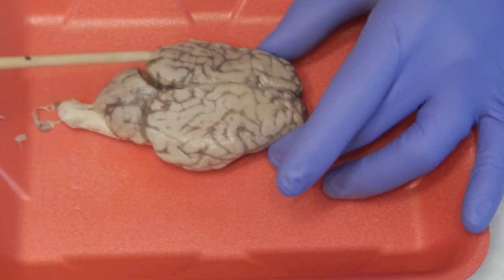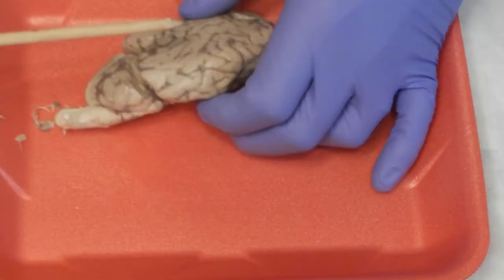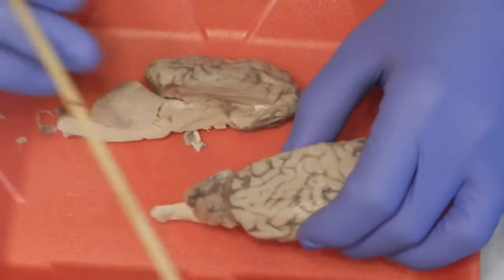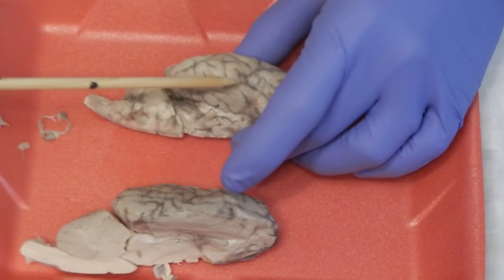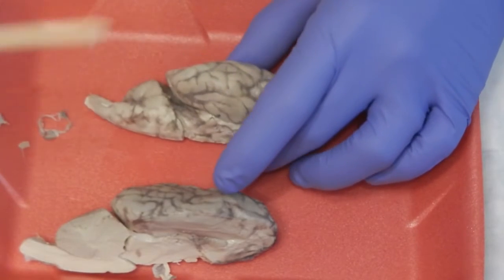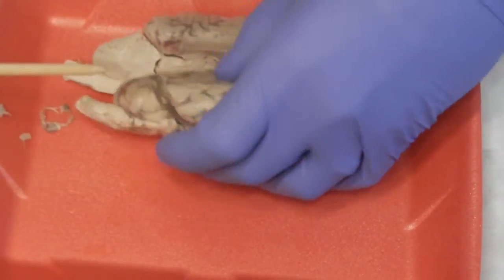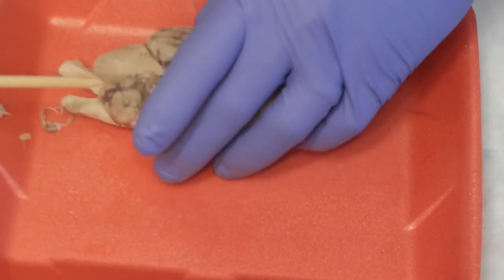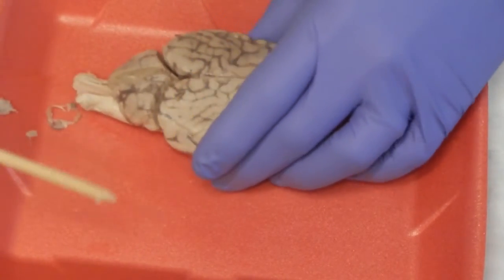We have the occipital, or most rearward portion. We have the parietal lobes, and there's a small piece of brain, which I'm going to separate the two halves right now, that juts out underneath, and that is the temporal lobe. Of course, the temporal lobe is the area that's closest to the ear. Also, the temporal lobe houses an area called the hippocampus. So the hippocampus is, of course, responsible for long-term as well as short-term memory.